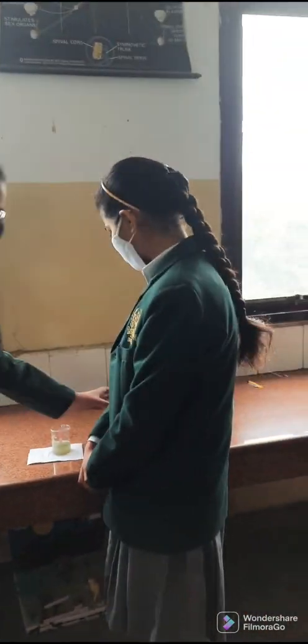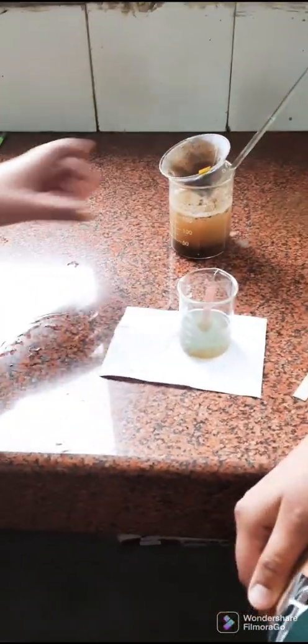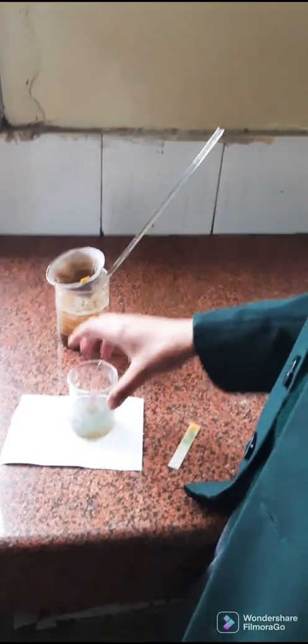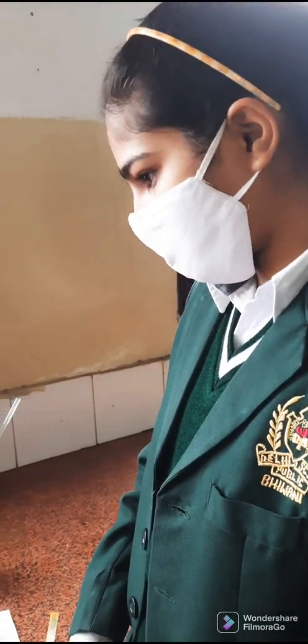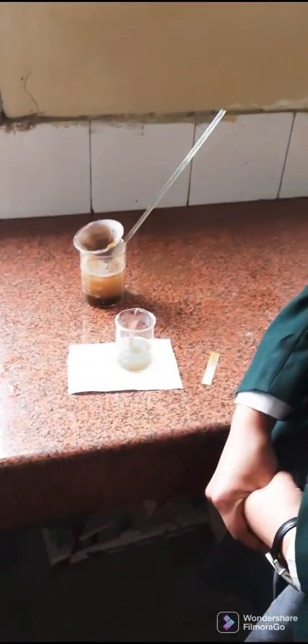This is Group 1 — Sunidhi and Udita. They filtered their soil solution and took their sample from near the roots of plants. The pH they got is between six and seven.